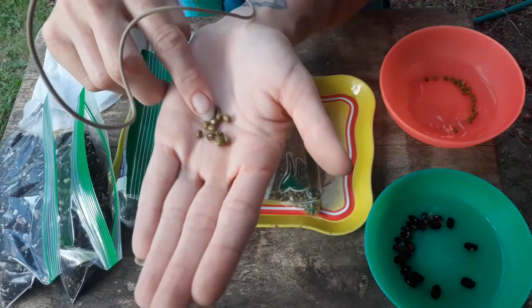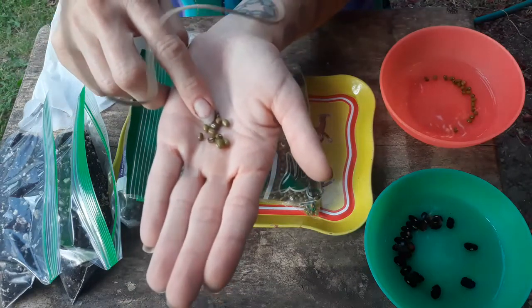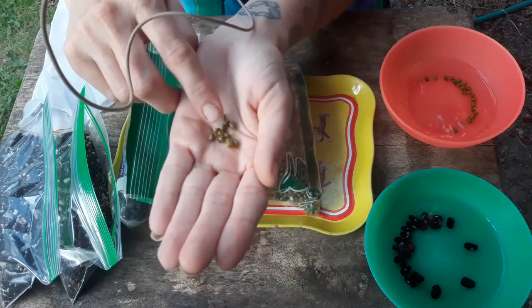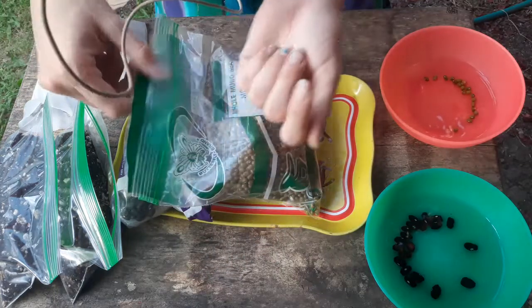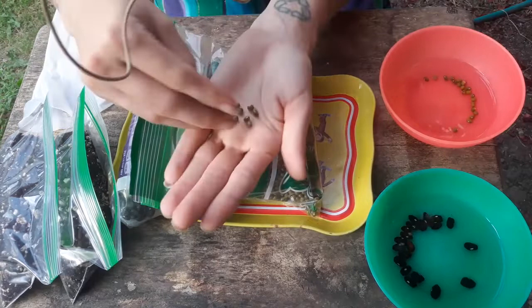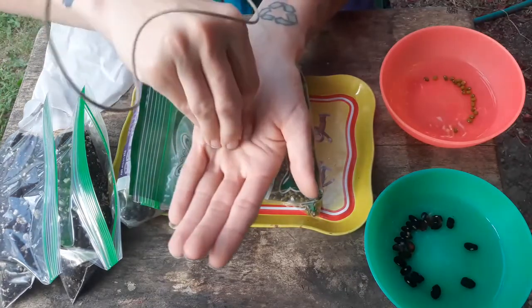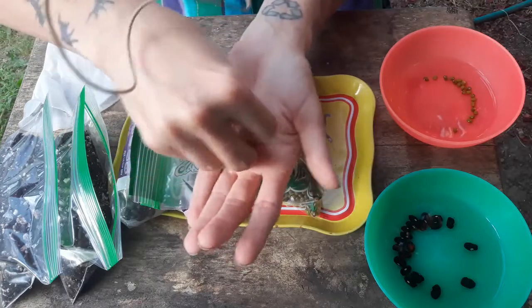At this particular area where the seed was connected to the plant, you'll often see a little bubble form there — there's a little pocket of air that keeps the seed breathing on the inside. You're going to want to take 60 of these beans and soak them in water for about 30 minutes.